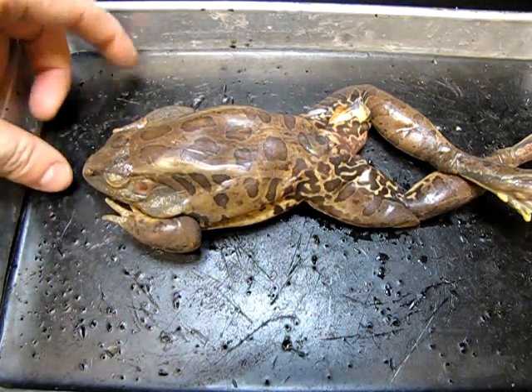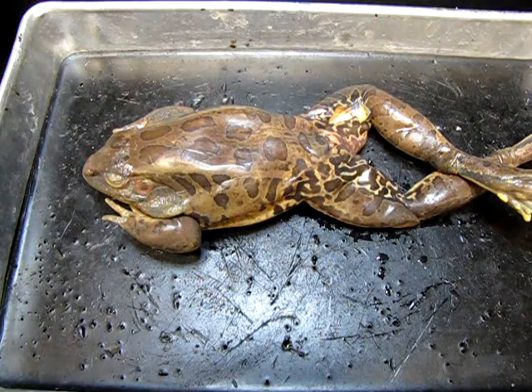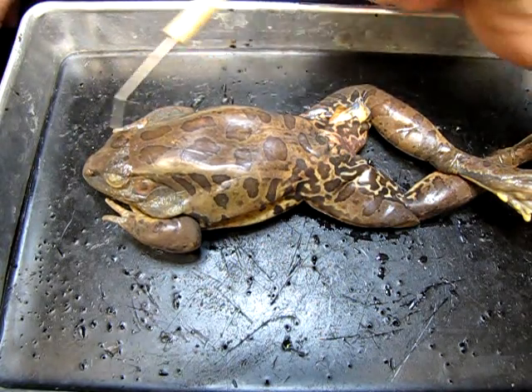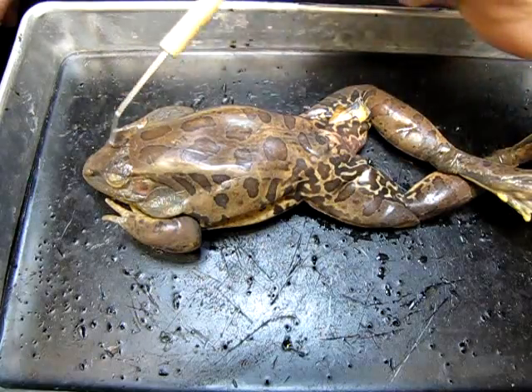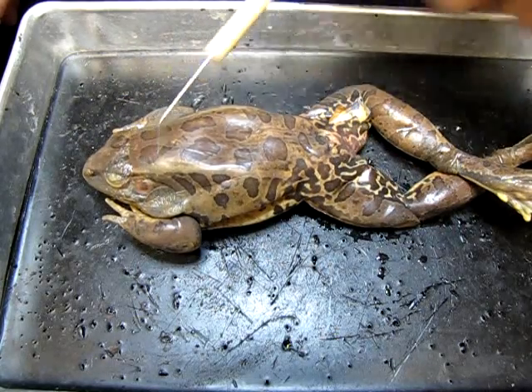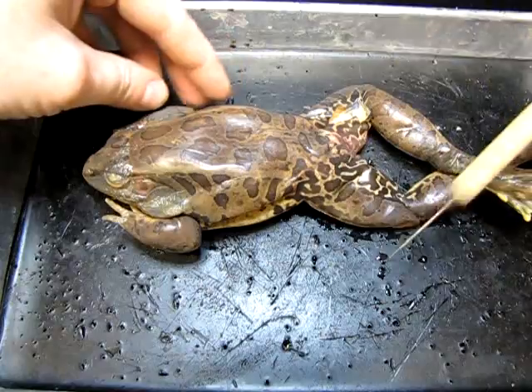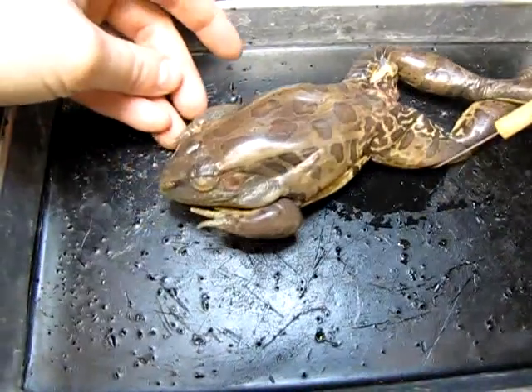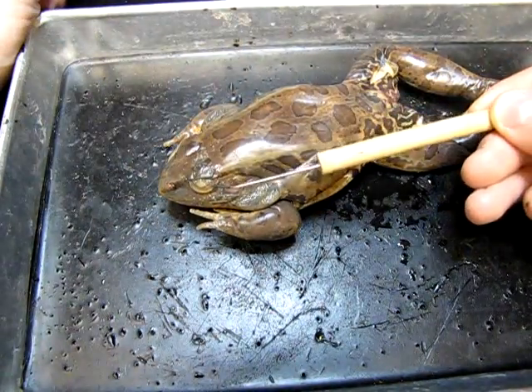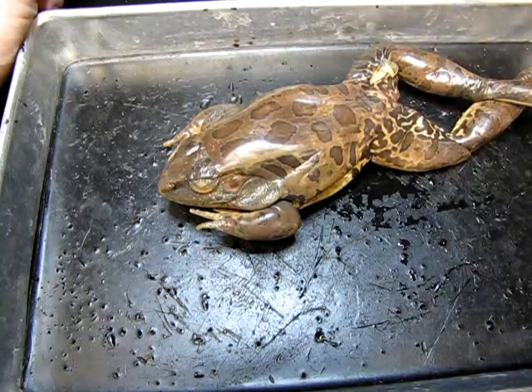In terms of the external anatomy of this animal, you can see the head area here, and then this is the trunk down here. The head obviously has some sensory organs. There are a large pair of eyes up near the front of the face.